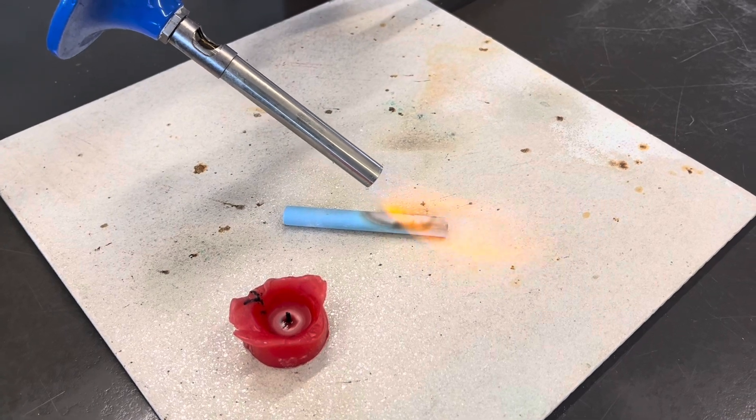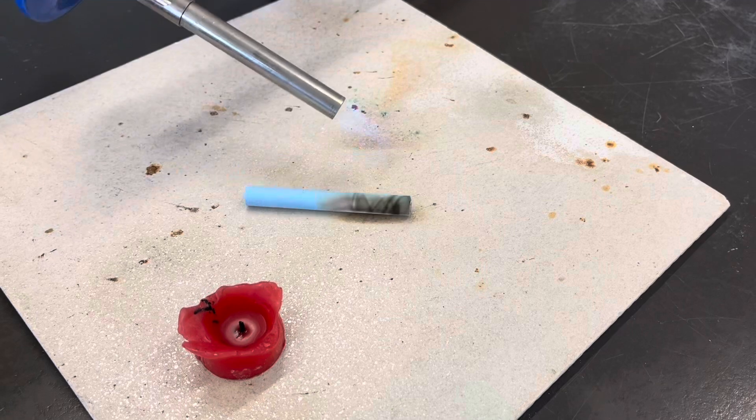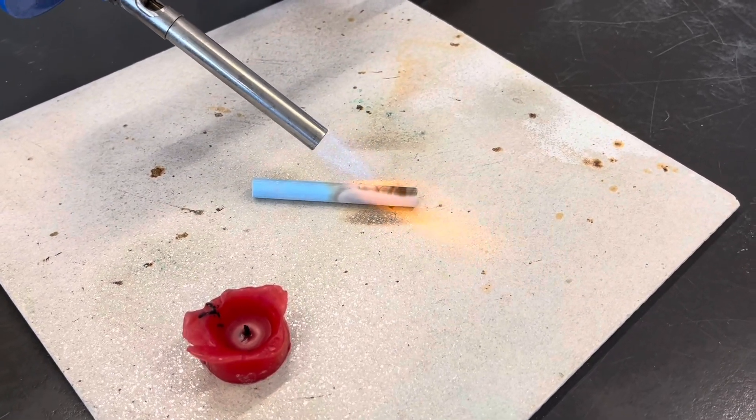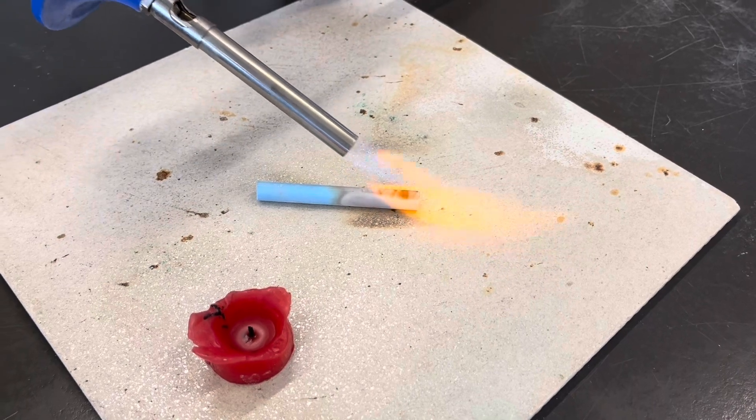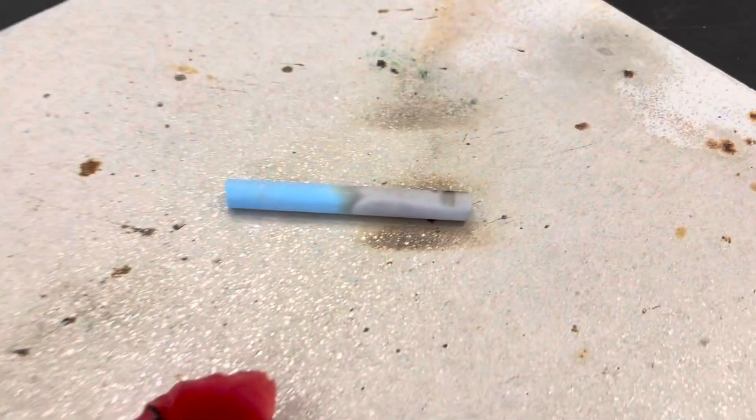The black substance is gone. Can you see? The black substance is gone.